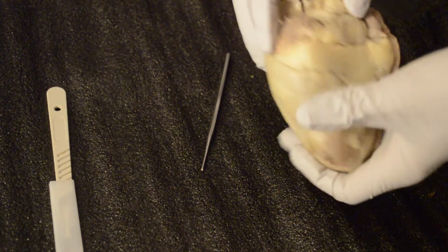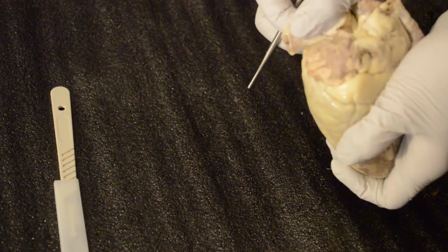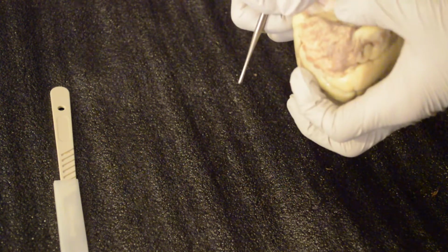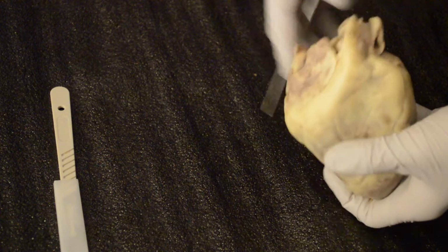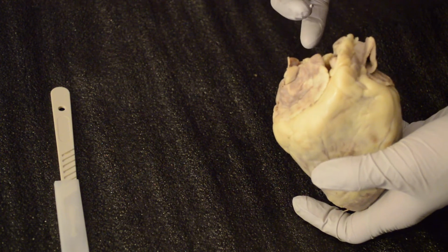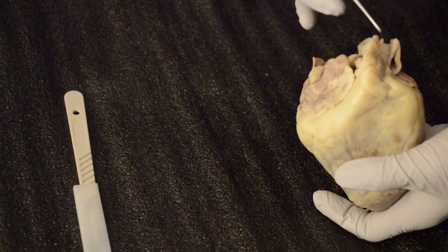Okay, moving on with the next one, we have the aortic arch. The aortic arch is going to be actually right here. These again feed into right there, if you can see it. Aortic arch is right there. All right. This aortic arch is actually on the transverse side of the aorta. It goes along, again, the transverse plane, and has typically, again, 3 branches as described earlier: the brachiocephalic, the left common carotid, and the left subclavian.